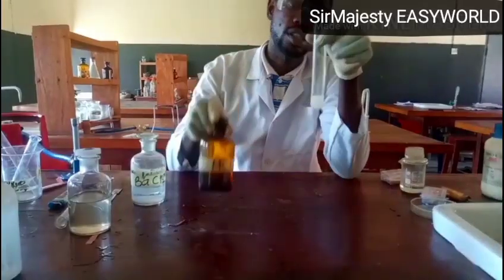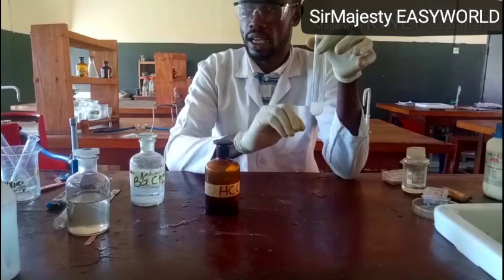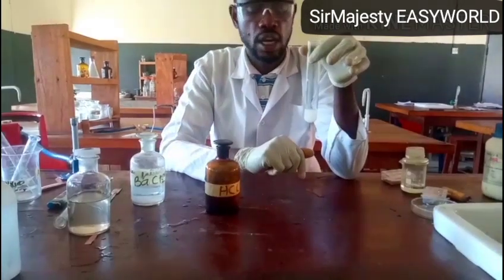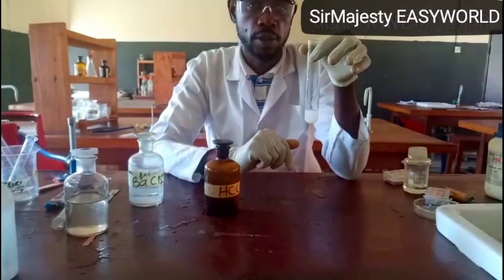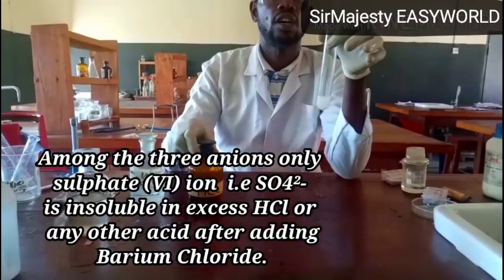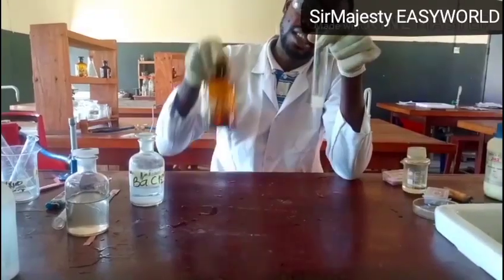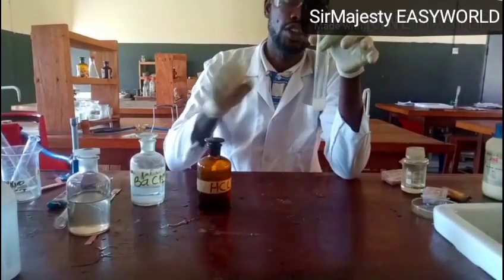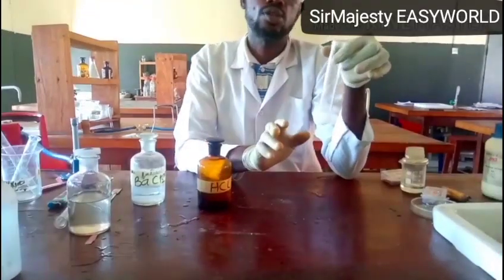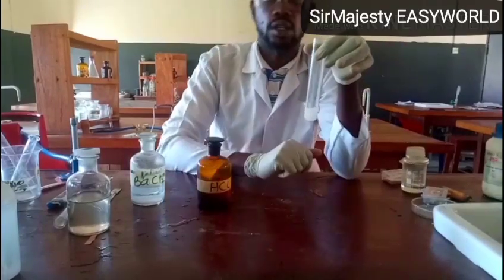If I add this dilute HCl and the precipitate remains as it is now, it shows that what we have is SO4 2 minus. So what does it show? That when you add barium chloride to a known sample, the formation of white powdery precipitate which persists in dilute HCl confirms the presence of sulfate. But if I add this dilute acid, and it shows effervescence and eventually the precipitate dissolves, I am suspecting two things: no more SO4, I'm looking at SO3 and CO3.